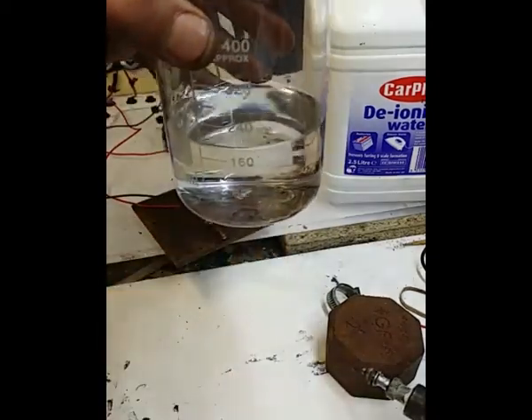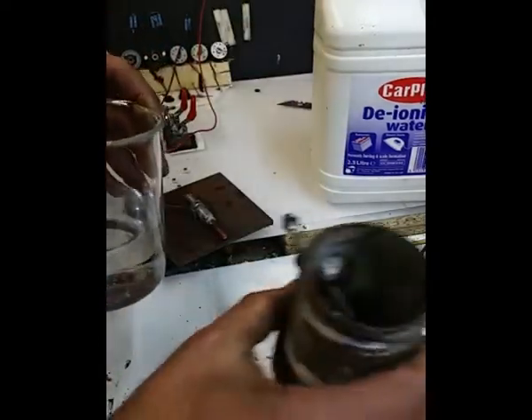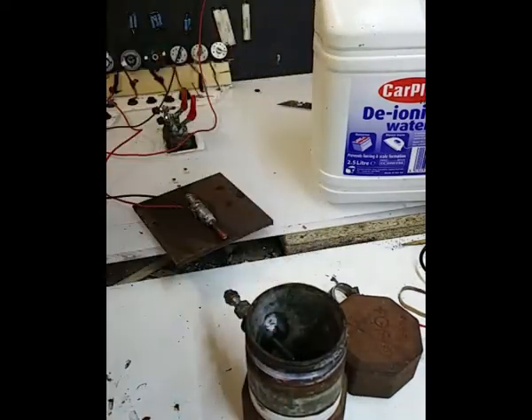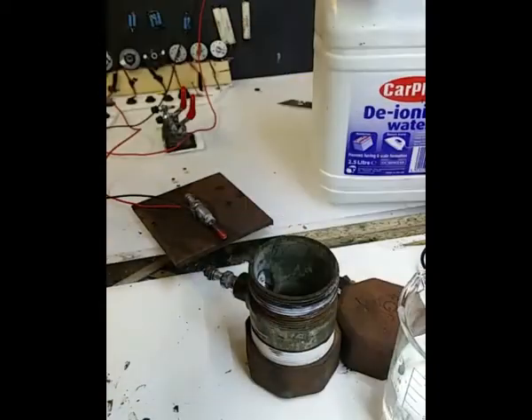So that is 200 millilitres total capacity inside there. I mean, you're not going to fill it up to 200 millilitres, but what I'm saying is that that's the capacity of that. So there you go.